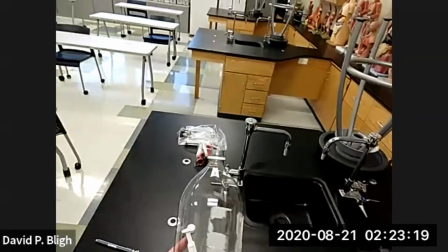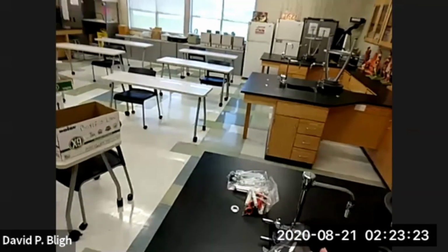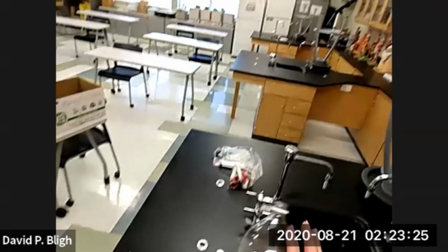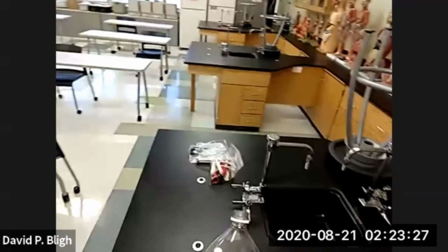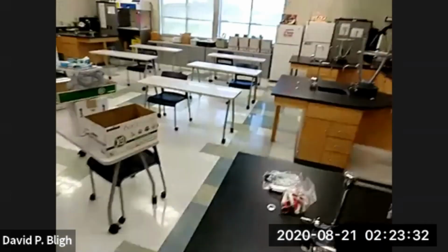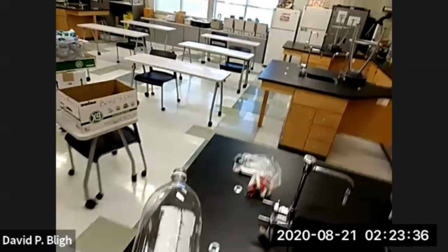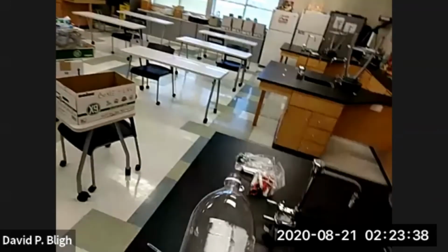And the way it's constructed, these vessels are supposed to be good to 100 psi. So we were well within limits, but it's been stressed once, contracted, stressed again. If we do it again, it's stressed again, and too many stresses will cause an explosion or catastrophic failure.